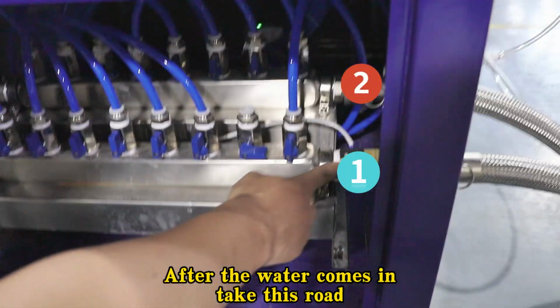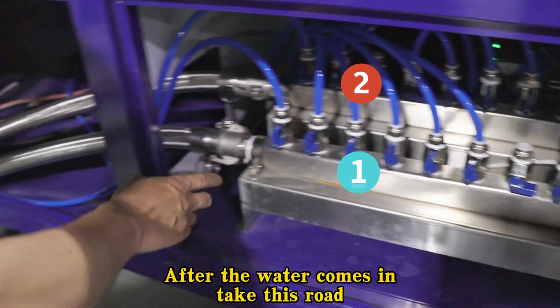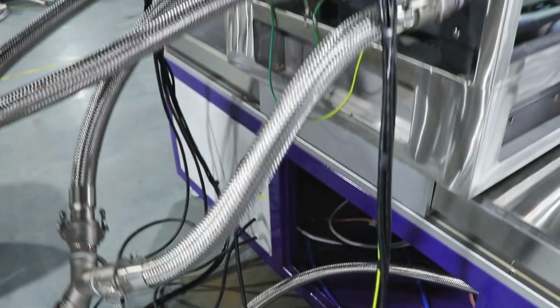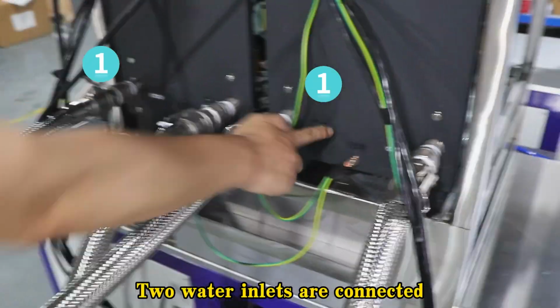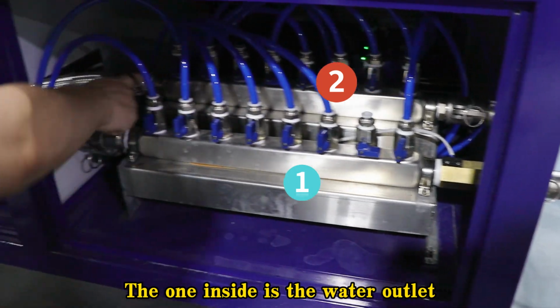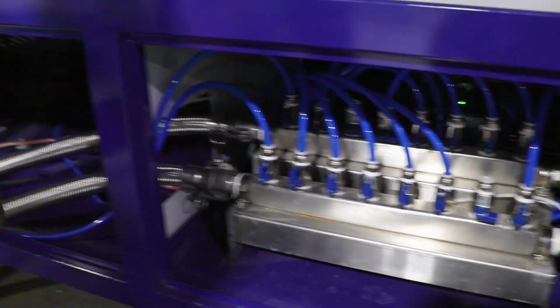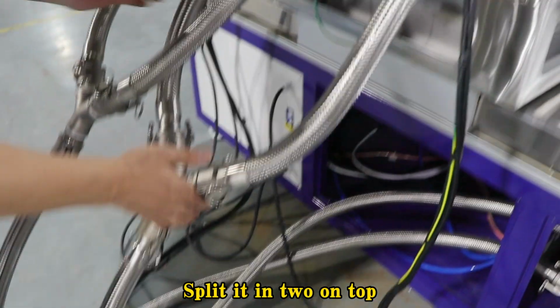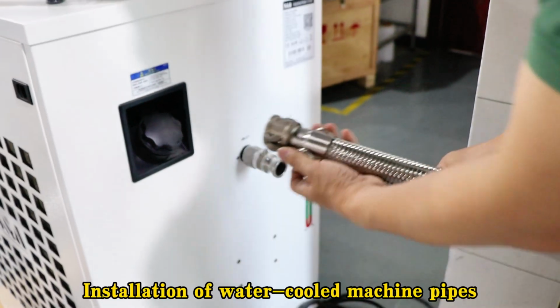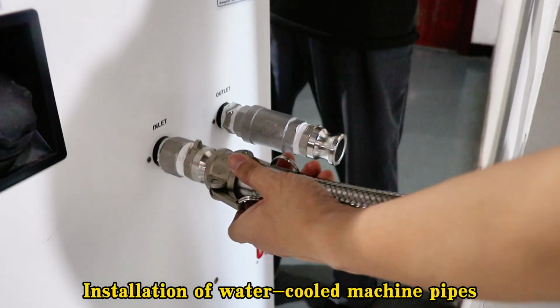After the water comes in, take this road. When you reach the top, it splits in two. Two water inlets are connected. The one inside is the water outlet. Split it in two on top, linking the two water outlets. Installation of water-cooled machine pipes.